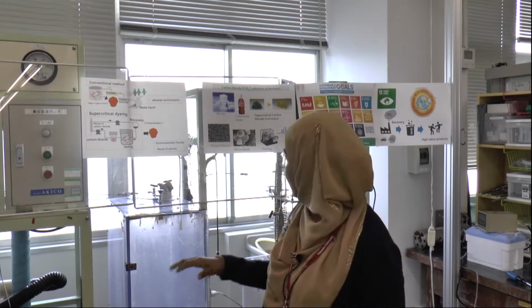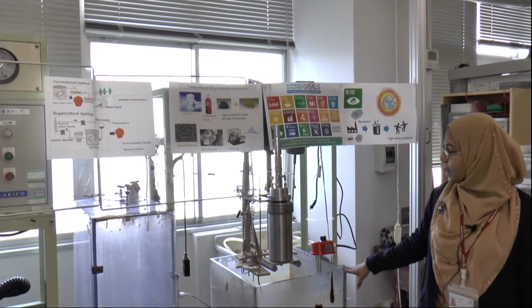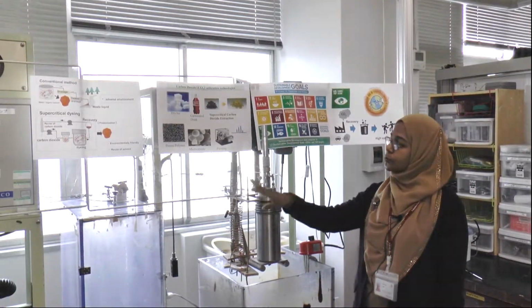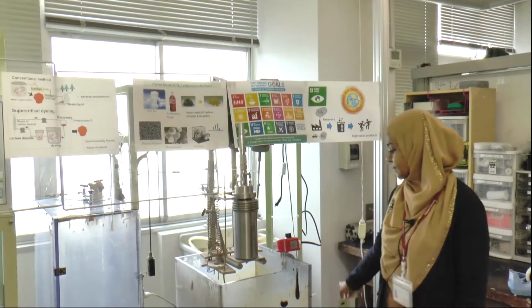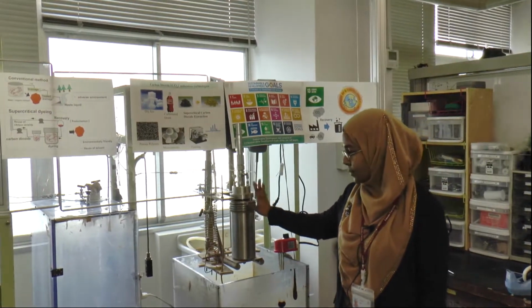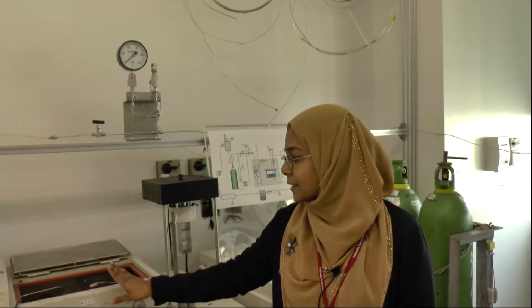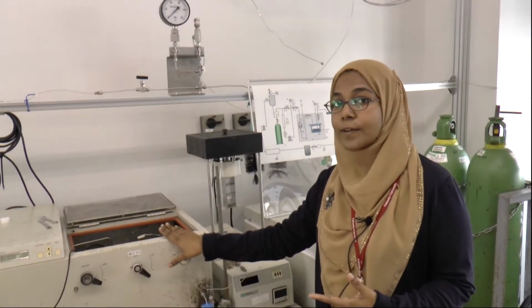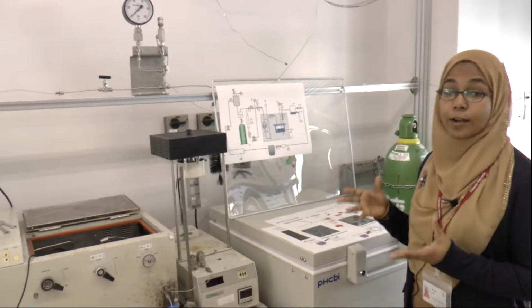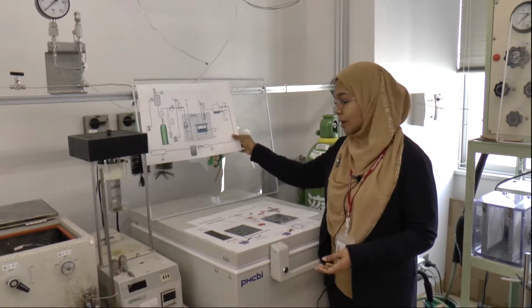Okay, so in this you can see this structure process. So this is called high pressure cell. Use supercritical carbon dioxide or liquid carbon dioxide, and then we recycle carbon dioxide through this cell. And others are like, we use supercritical carbon dioxide for extraction of the organic solvent from emulsion to make nanoparticles. Like this shows the schematic diagram of this process.